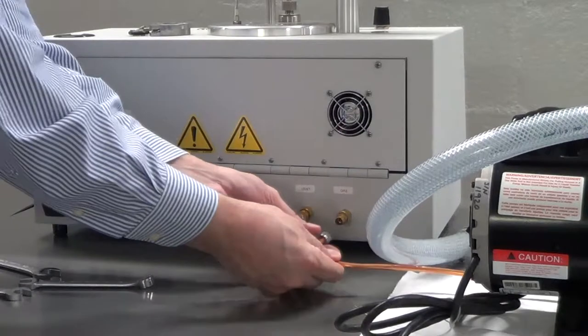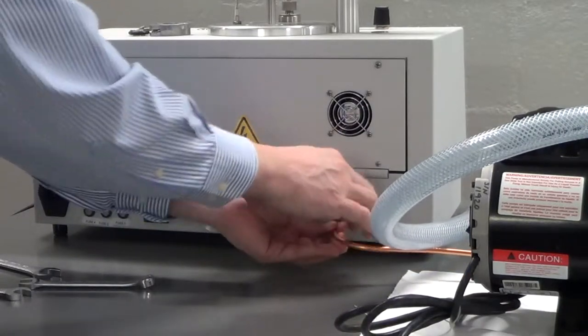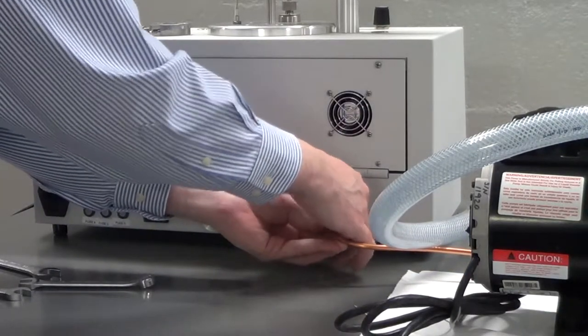Next, you'll want to connect the gas line, using the appropriate connector to match the adapter you just installed.